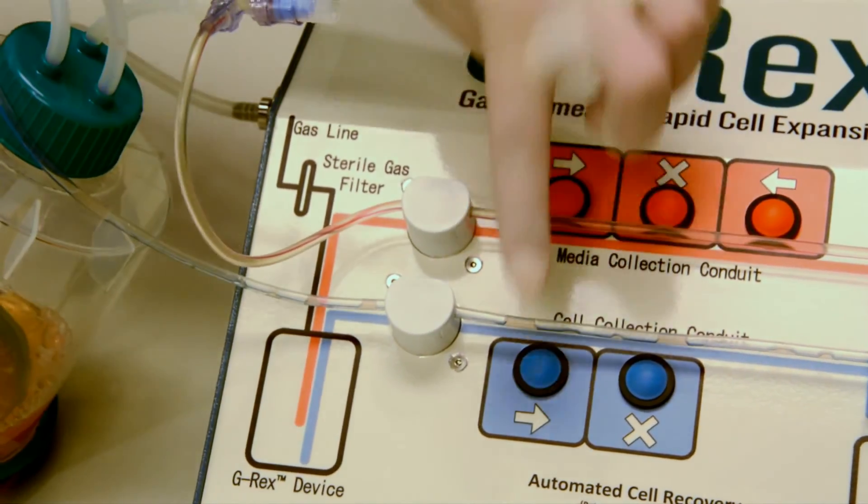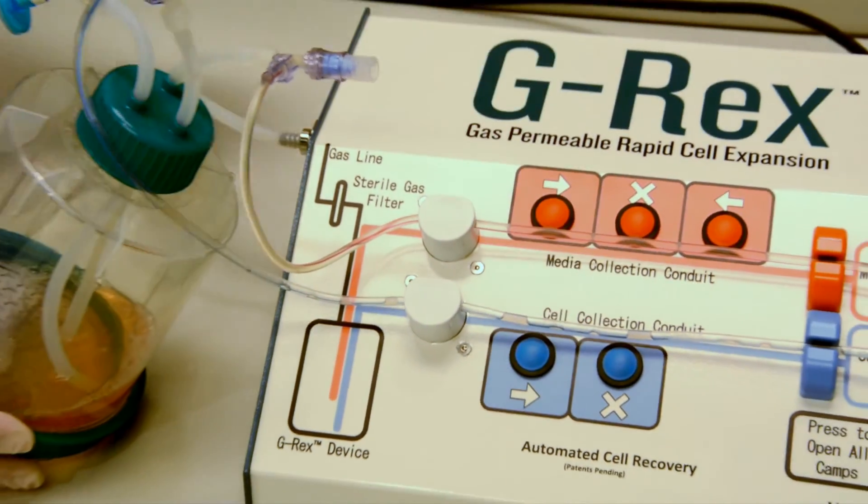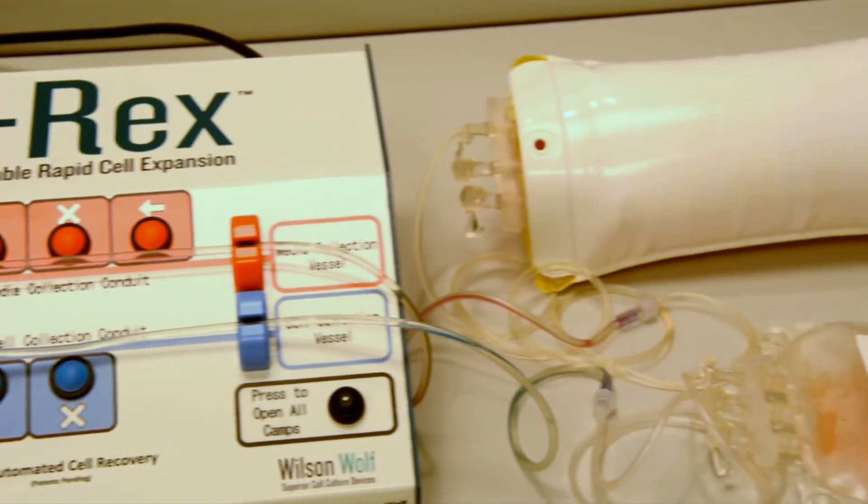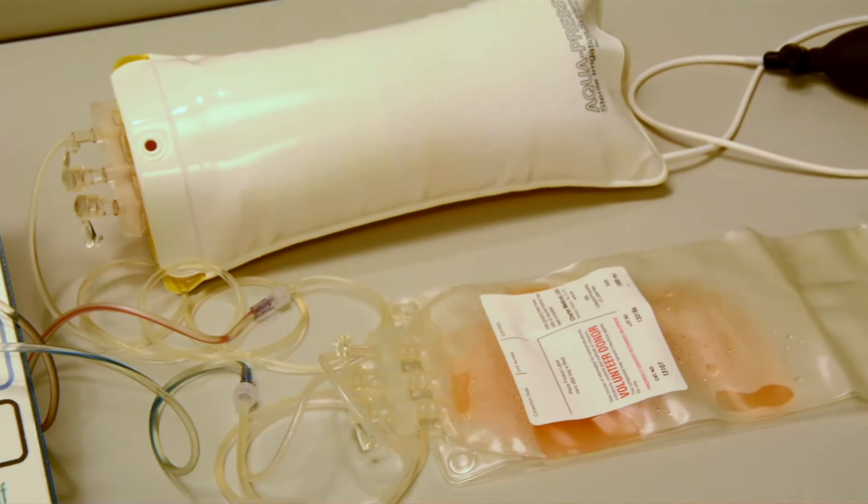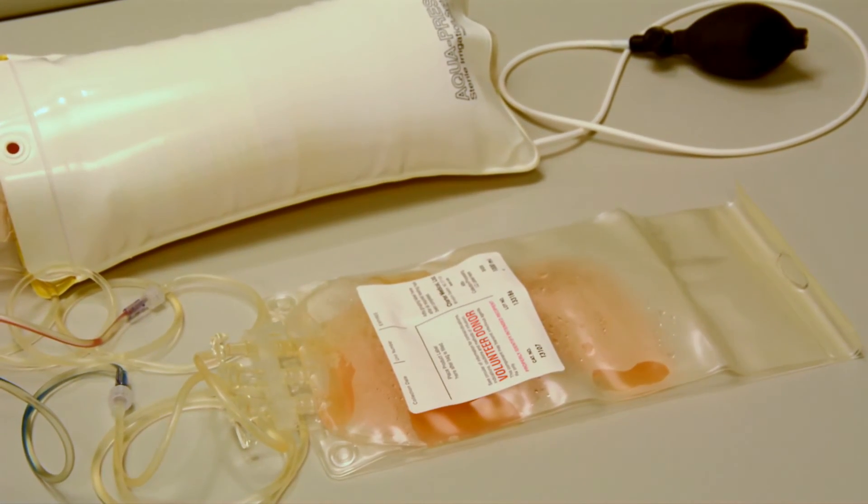Finally, by once again pressing the cell collection button, we stop the flow of media back into the G-REX and drain the residual cells into the cell collection bag.